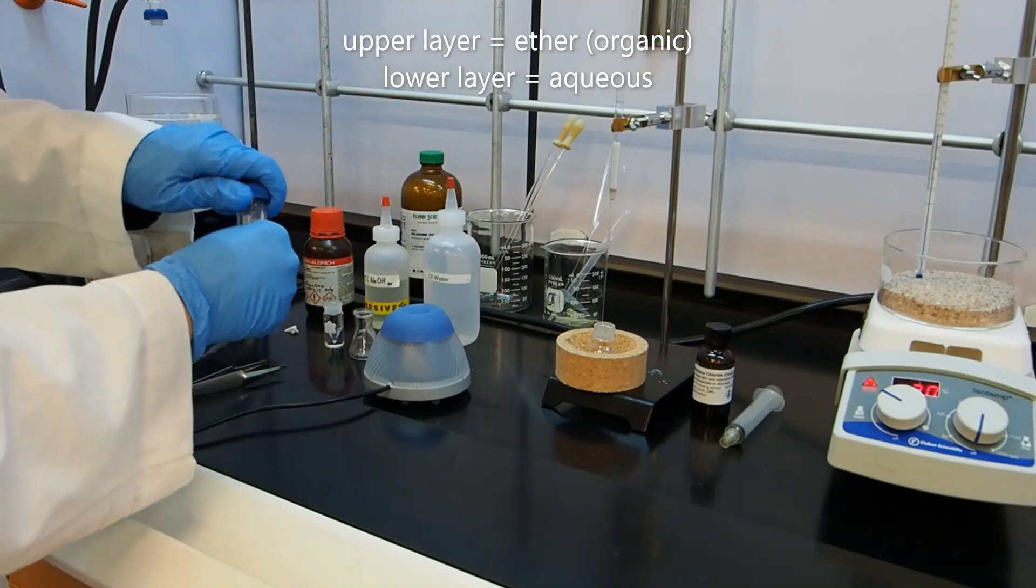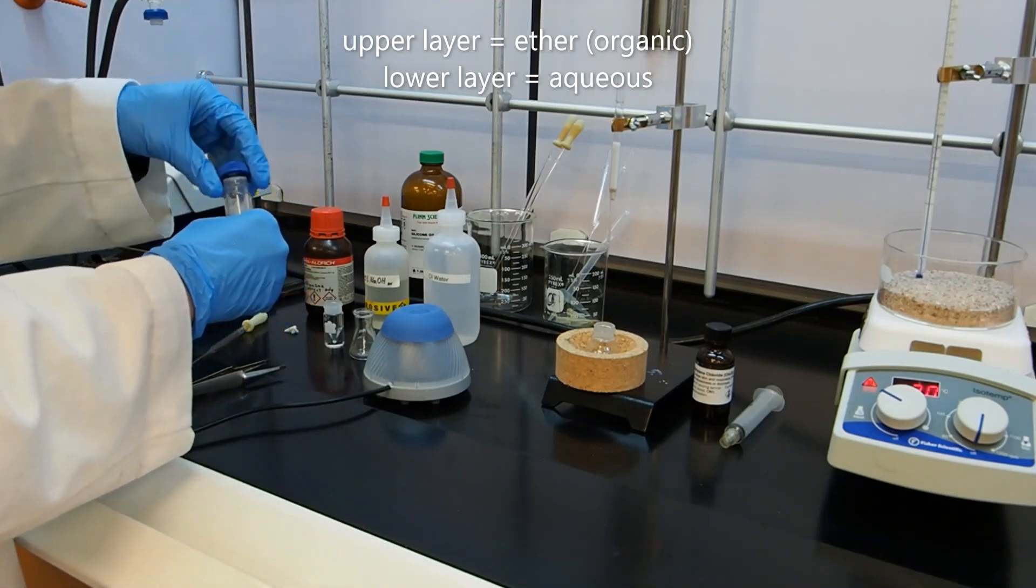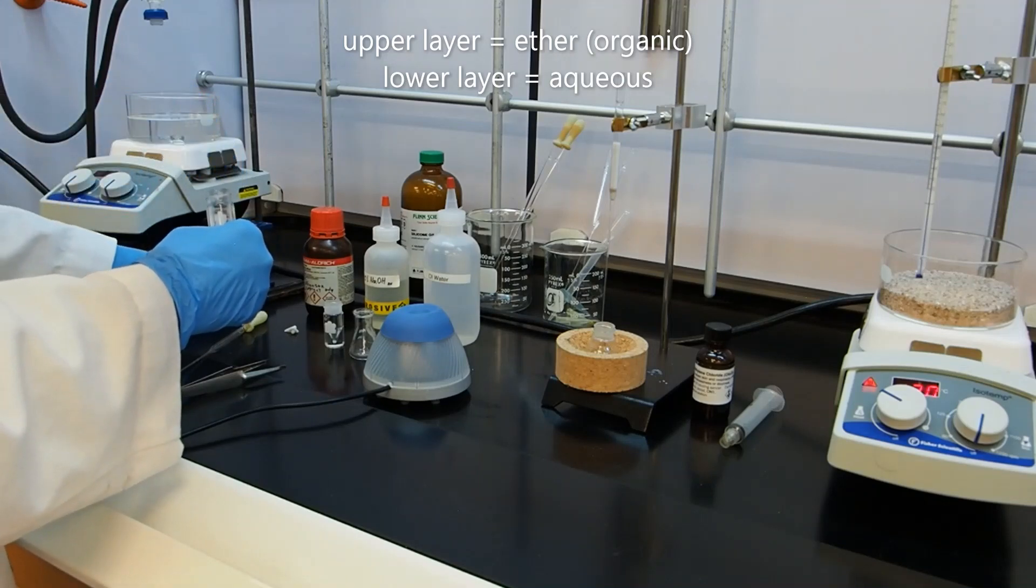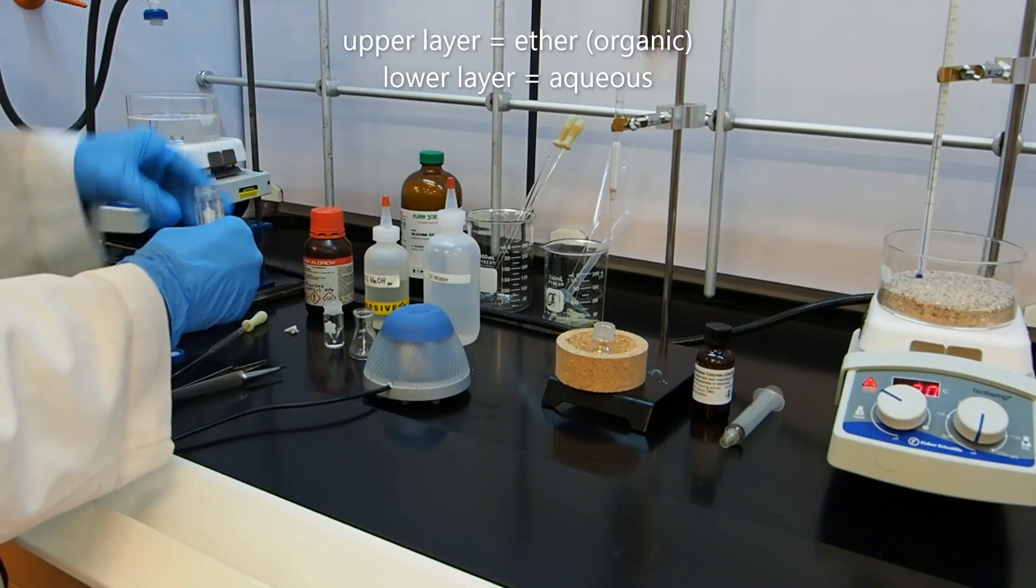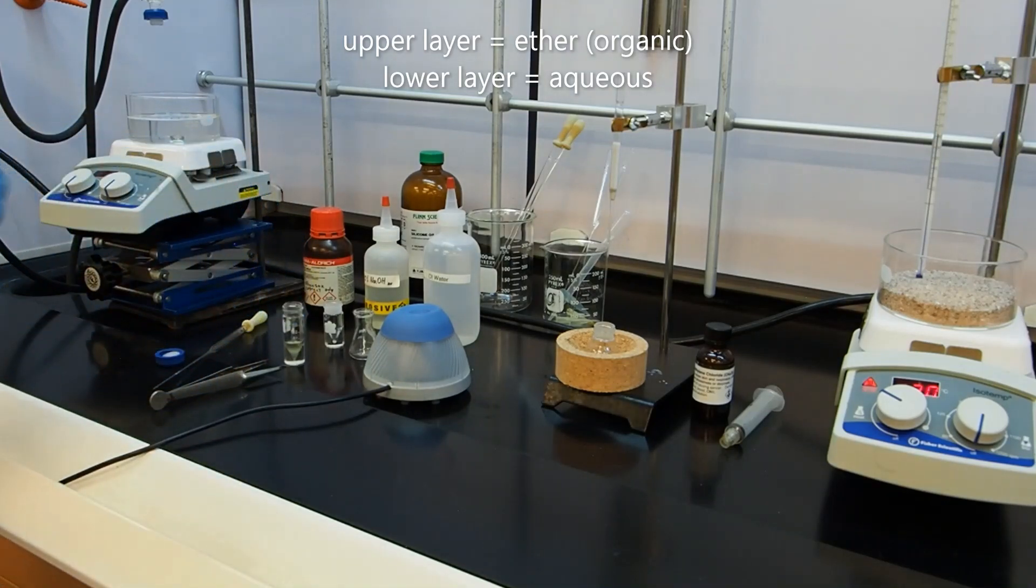The point of this is to use the ether to draw our product, which is organic, out of the water. So we're going to vent it and give it a second to settle. And we should again have two layers that have been thoroughly mixed. And hopefully now our product is mostly in the top ether layer.